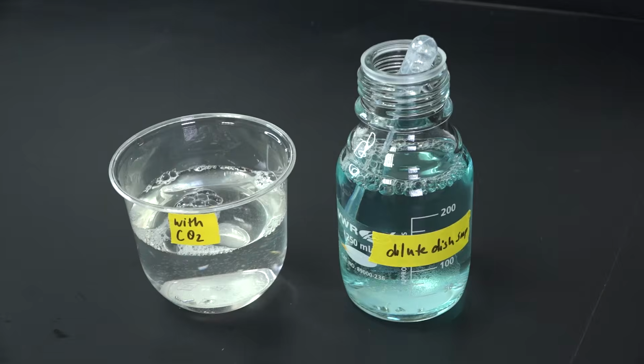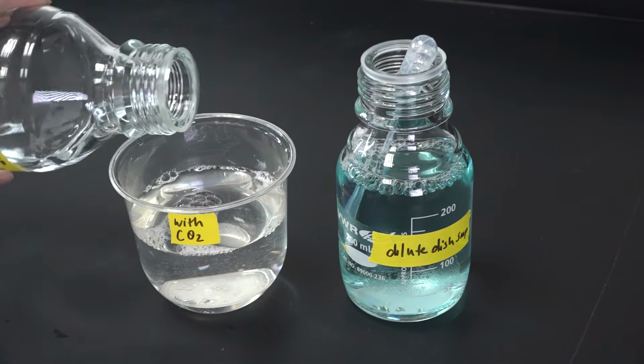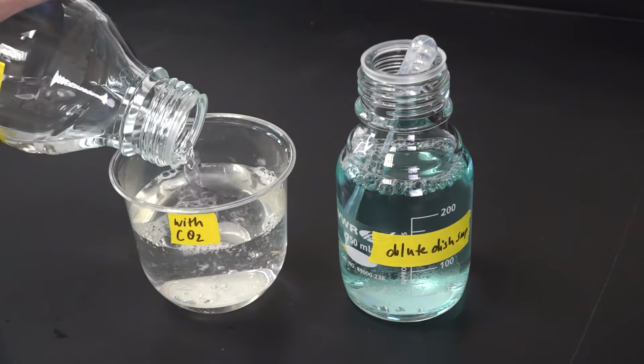Leaves are covered in a waxy cuticle that repels water. This soap makes the surfaces of the leaves less hydrophobic, so it's easier for the solution to get drawn in by the vacuum. We don't want it so soapy that it causes suds, though. If I see suds, I need to dilute what's in the cup with more bicarbonate solution or water.